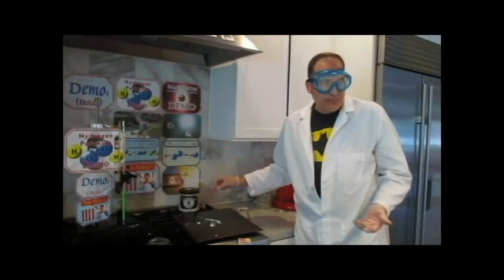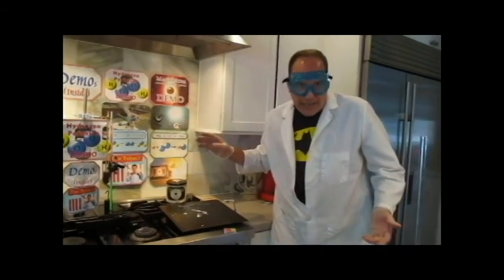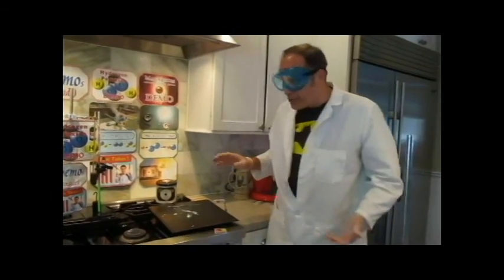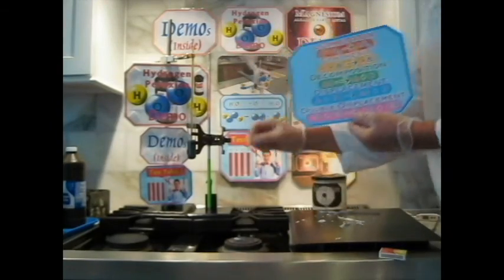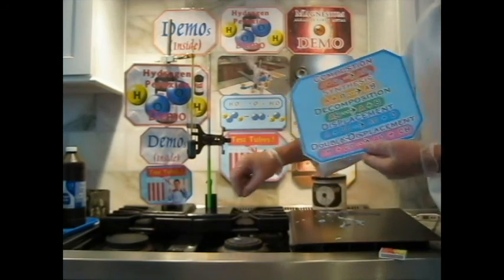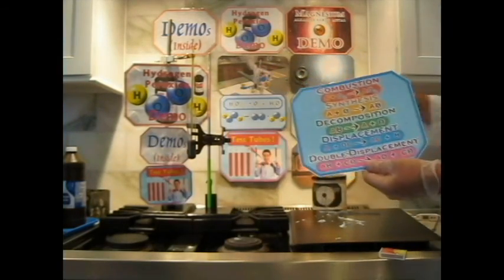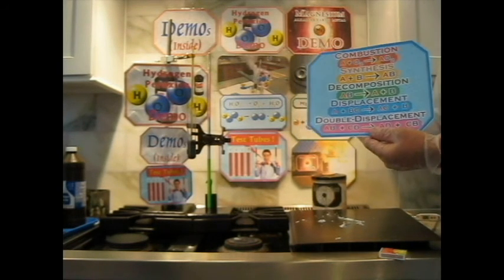Magnesium is no exception. So remember that you need to determine what reaction type that was. Of those reaction types, which type of reaction was lighting the match, which type of reaction was the actual stove burning, the gas burning, the methane, and the magnesium, the alkaline earth metal.